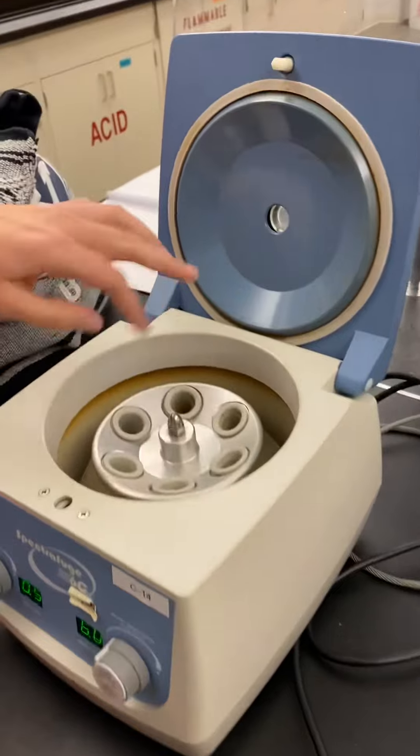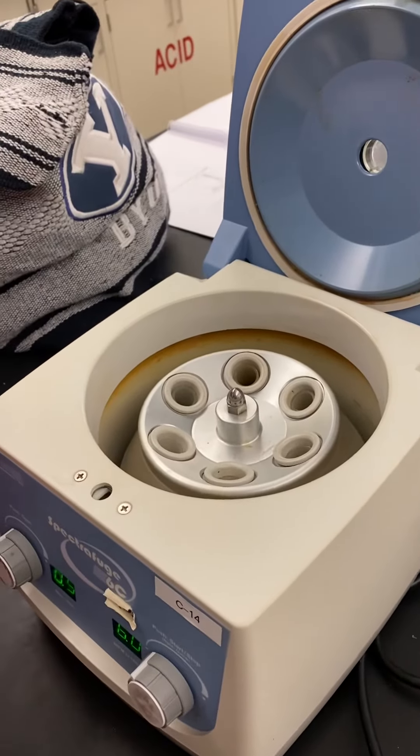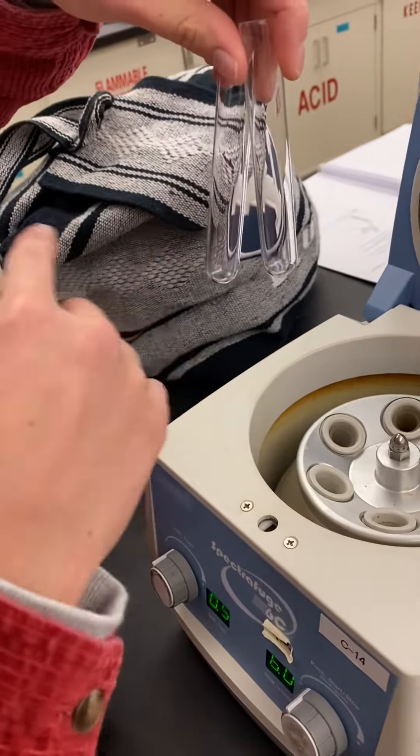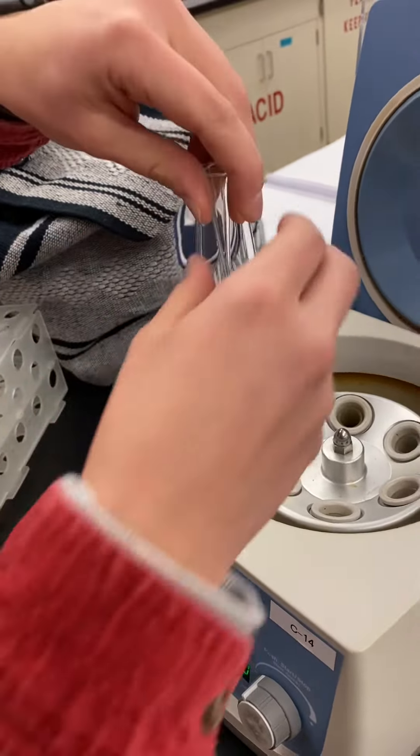As you can see in here, there's different holes or spots you can put it in. What's important here is that whatever's in your test tube, that they're about equal amounts.